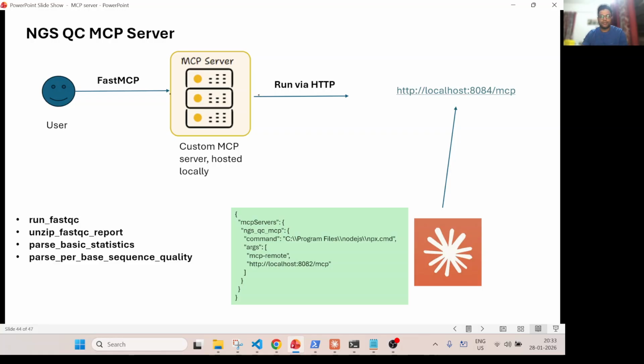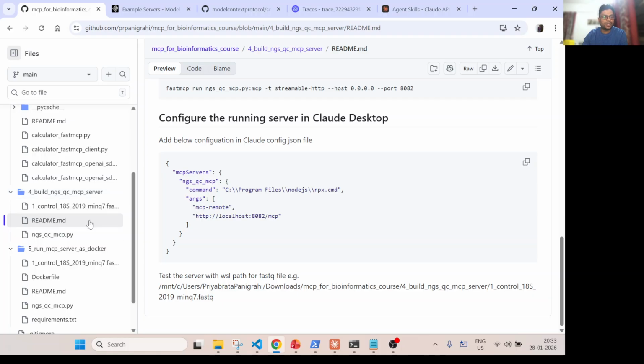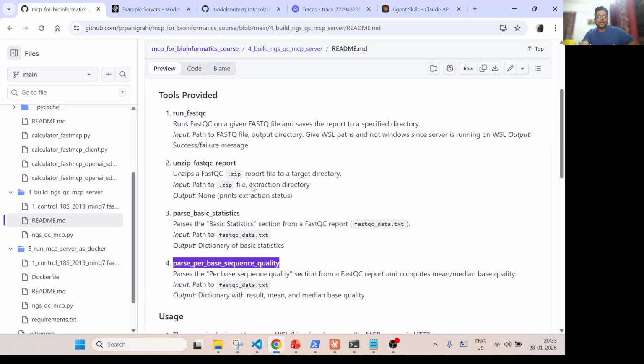If you go to my repository and see the readme, I have explained in detail what it does. Run FastQC will run FastQC on a given FASTQ file, but it is important that FastQC is installed locally and available in the PATH. I will be using WSL, and I have already installed FastQC.